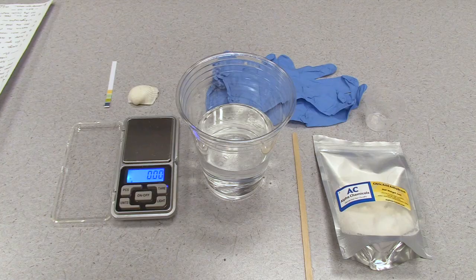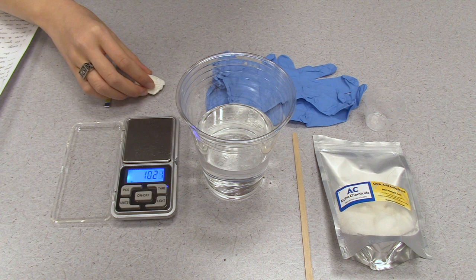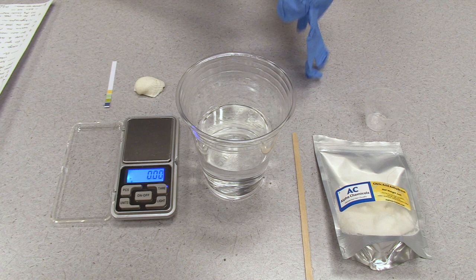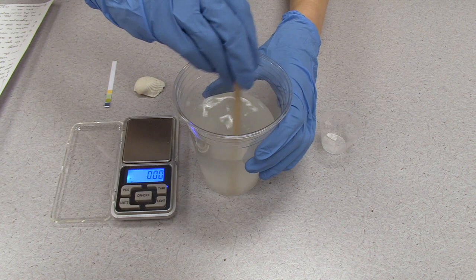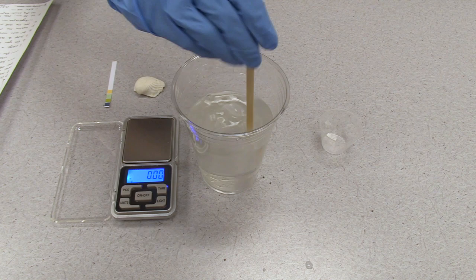First, take out one of your seashells and weigh it with your scale. Next, put on your elegant nitrile gloves, take a large plastic cup, and fill it with tap water about halfway. Measure out two scoops of the citric powder using a small but accurate measuring cup and put it into the water. Then stir well using the stirrer until all of the citric powder is fully dissolved. It might take a minute of stirring, but the water should look pretty clear.